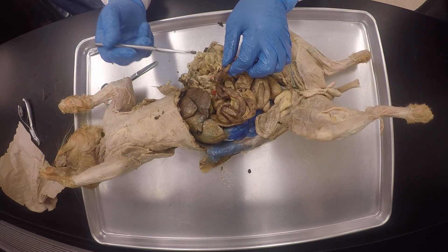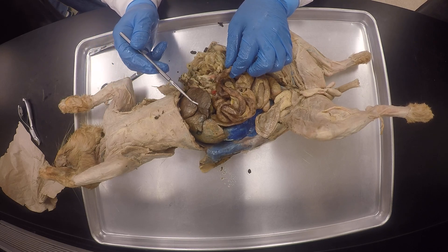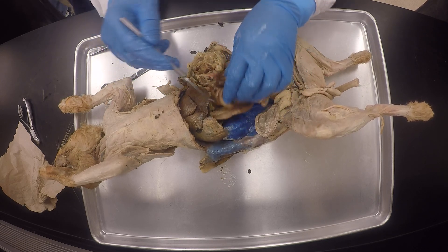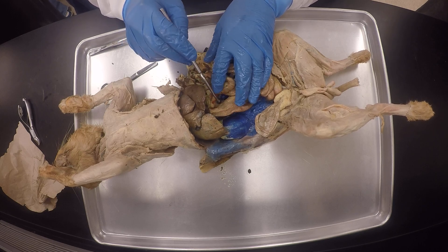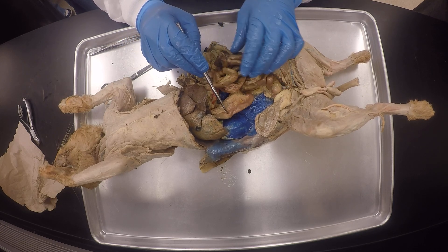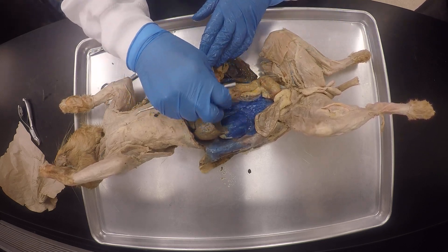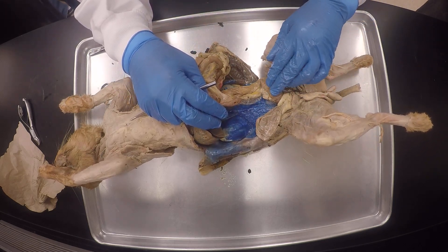You can't see the demarcation between the jejunum, ileum, and duodenum clearly. You know the duodenum because it's right after the stomach and it's by the pancreas. So: duodenum right after the stomach, anywhere in the middle is the jejunum, and then you have to look for the ileum close to the large intestine.